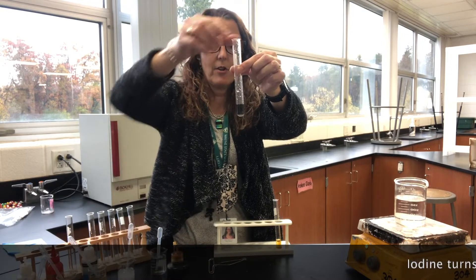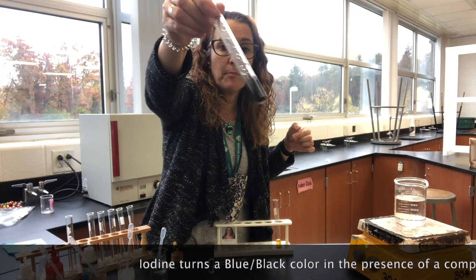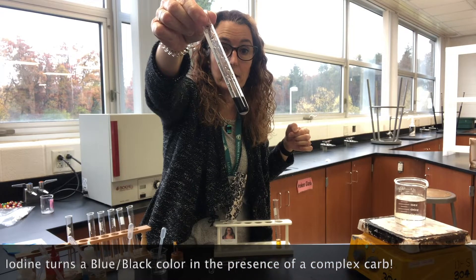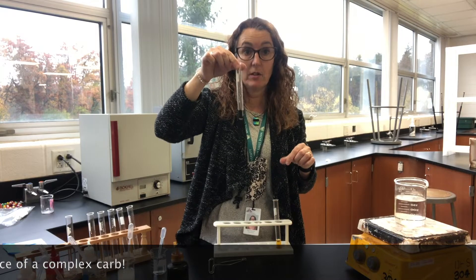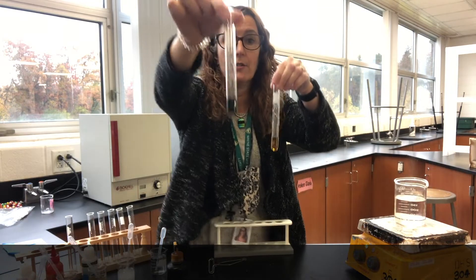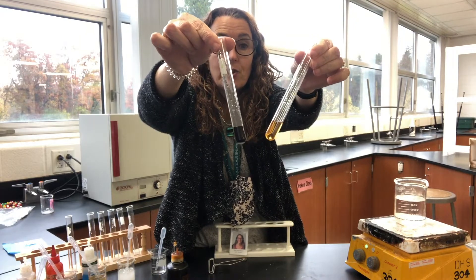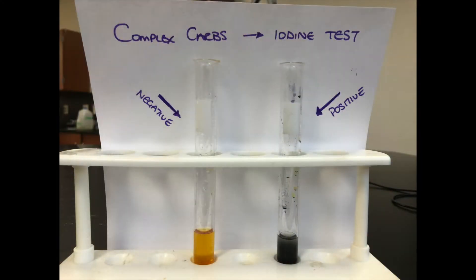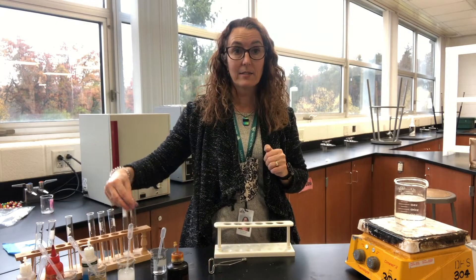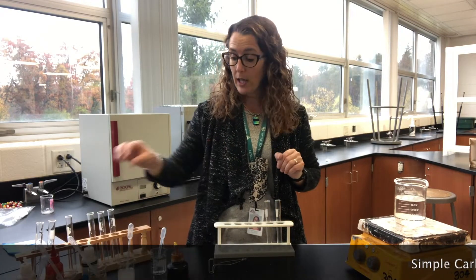You can see the iodine has gone a blue-black color. This is our test for complex carbohydrates — for starch, a positive result is blue-black, and a negative result just stays the regular brown color.